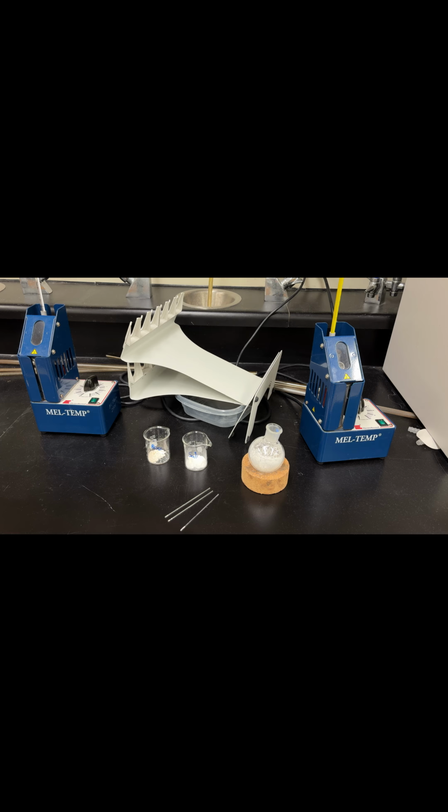So I ended up losing 17.7% along the way. It could have been from a few different areas. One of the easiest areas would have been it didn't get acidified enough. It didn't let cool off and crash out of solution. Those are 2 very simple reasons. There's several other reasons as well that it could be.